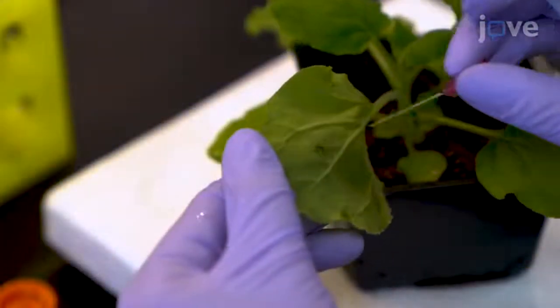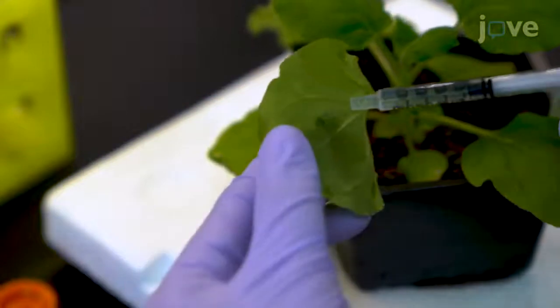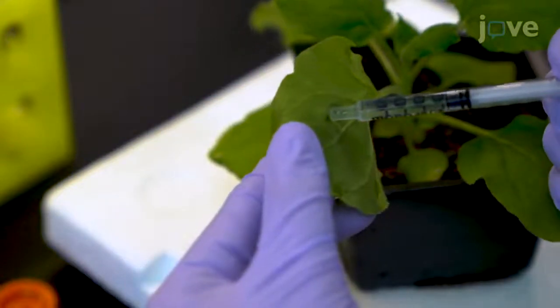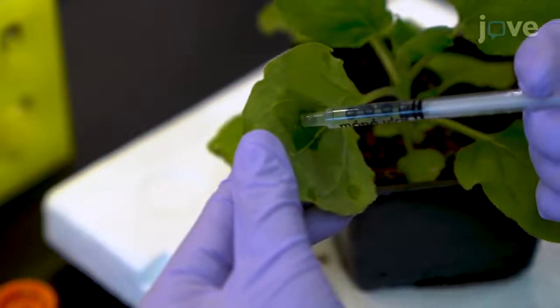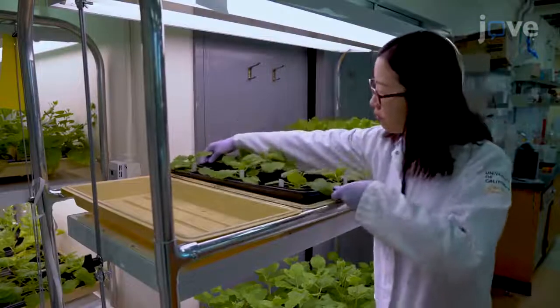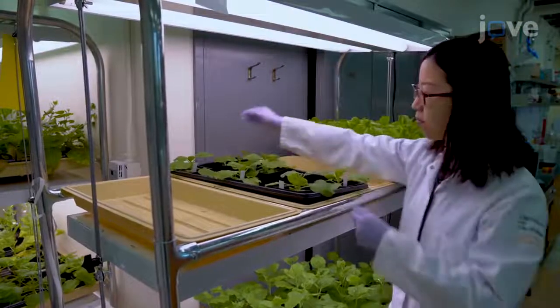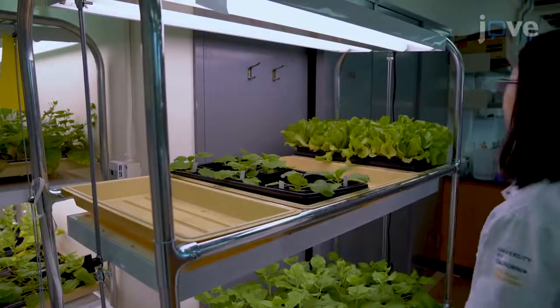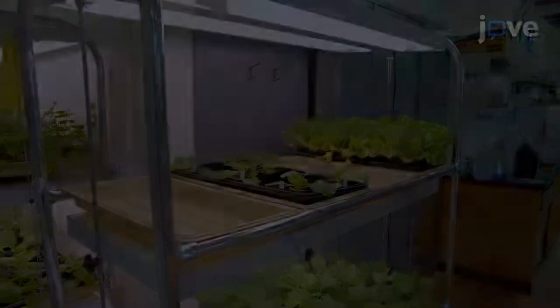At 36 hours post-infiltration, infiltrate 200 micromolar biotin into the leaves and maintain the plant for an additional 3 to 12 hours before harvesting the leaf tissue.